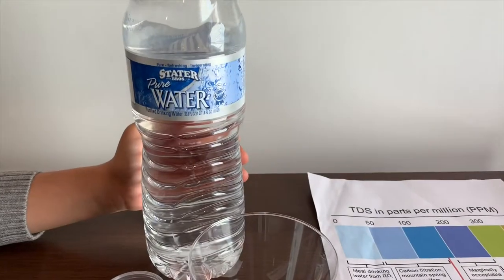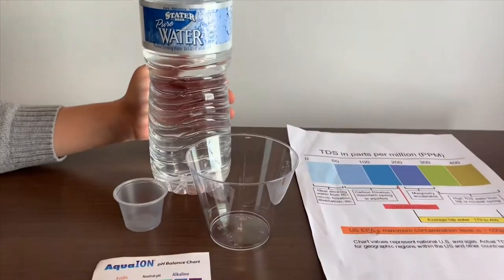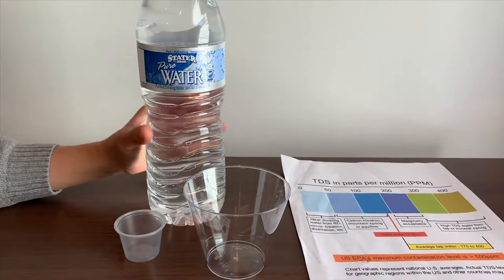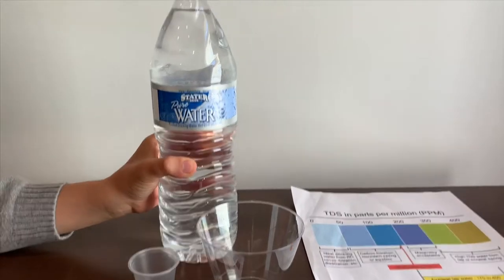This is Stater Bros Pure Water. It's purified drinking water and you can get it at Stater Bros stores. Let's test the TDS and pH levels.